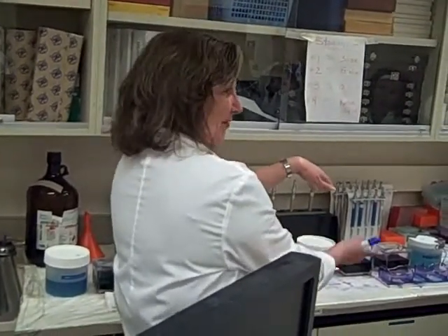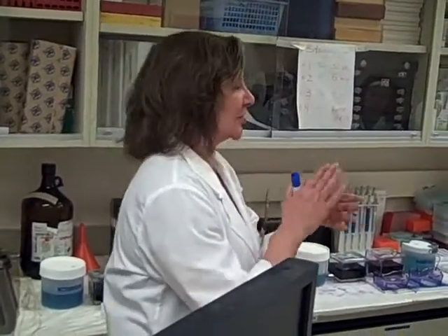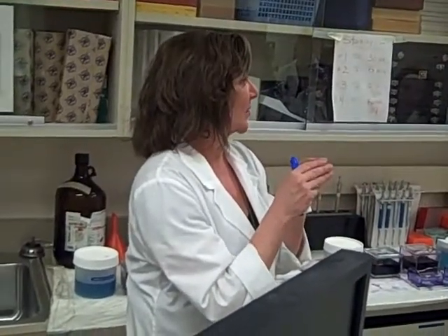Otherwise you'll lose the blood right there. And then you're going to turn in your best slides on each of your specimens — tape them upside down to your printout.